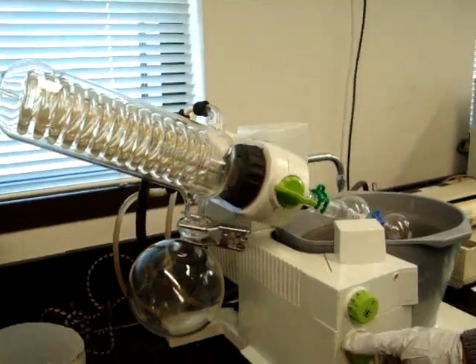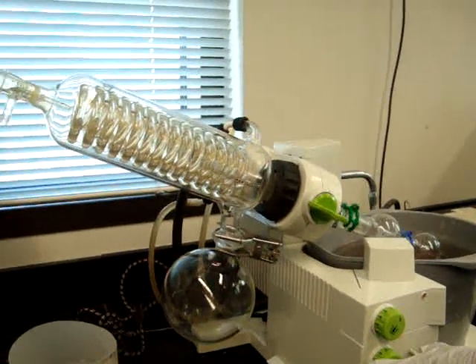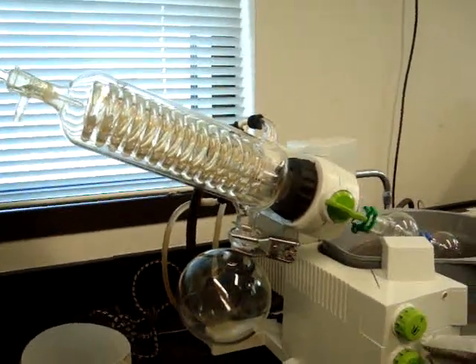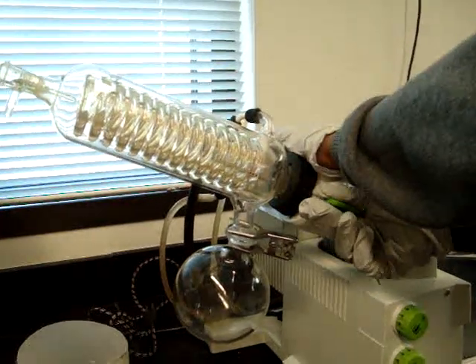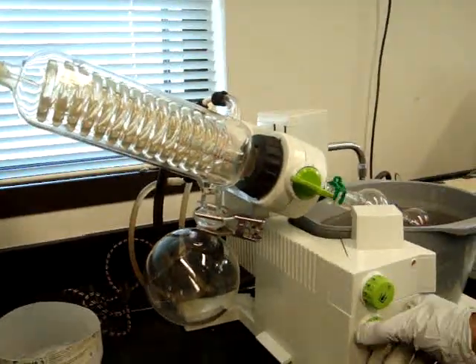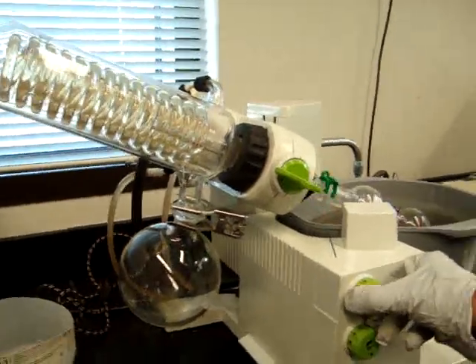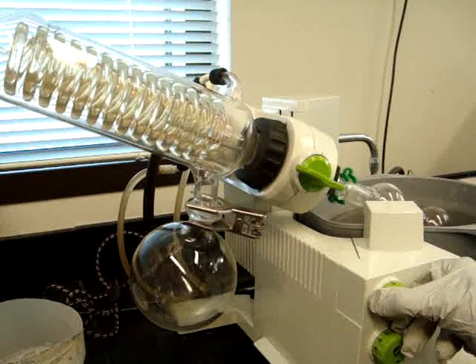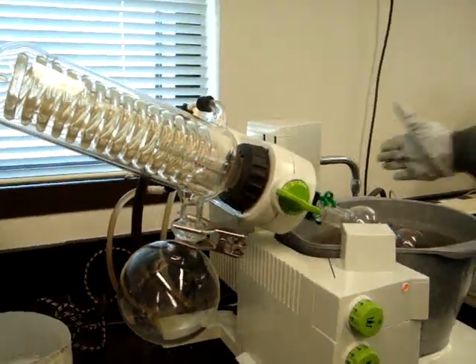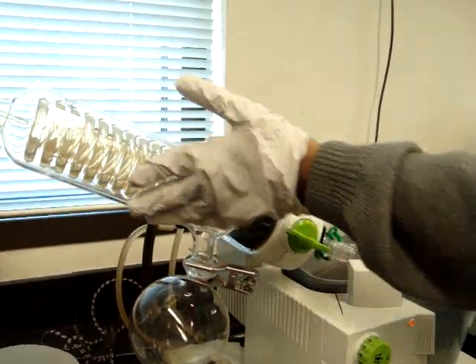You'll be using the rotary evaporator. First, you'll be turning on the vacuum, then closing the vent and lowering it into the water. Then you'll turn on the spin, and you'll also turn on the heat to about 30 to 35 degrees Celsius. Make sure that the water is also turned on.